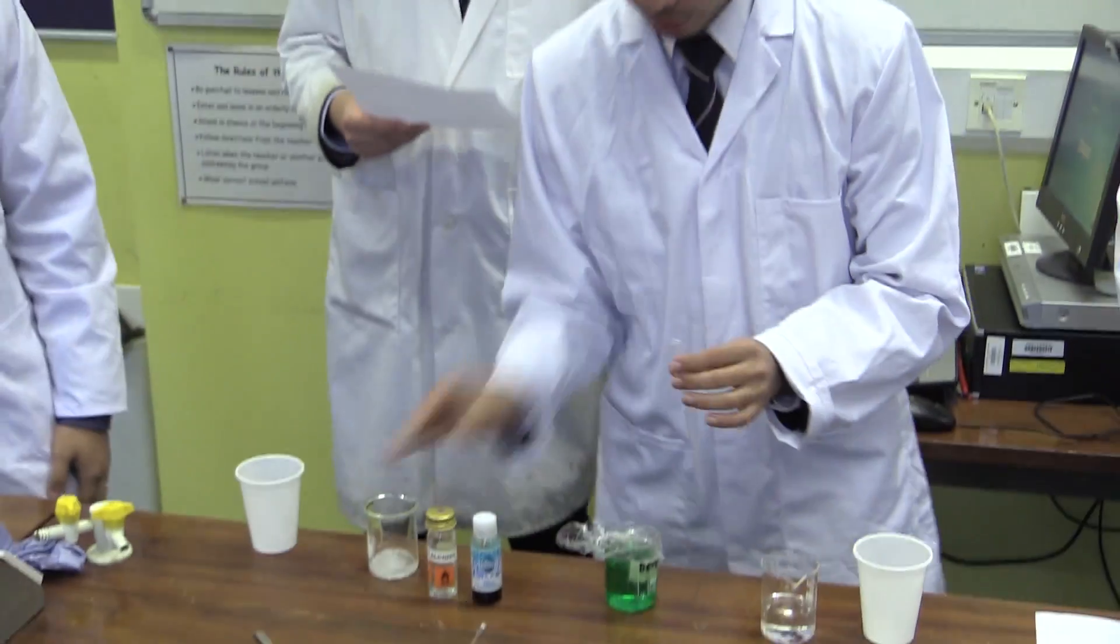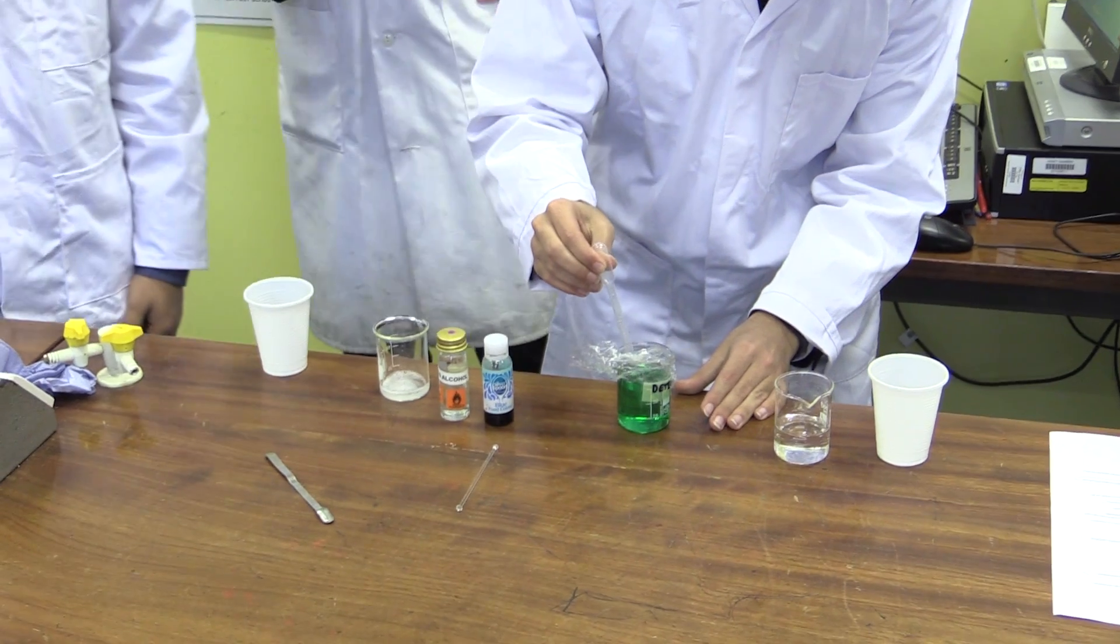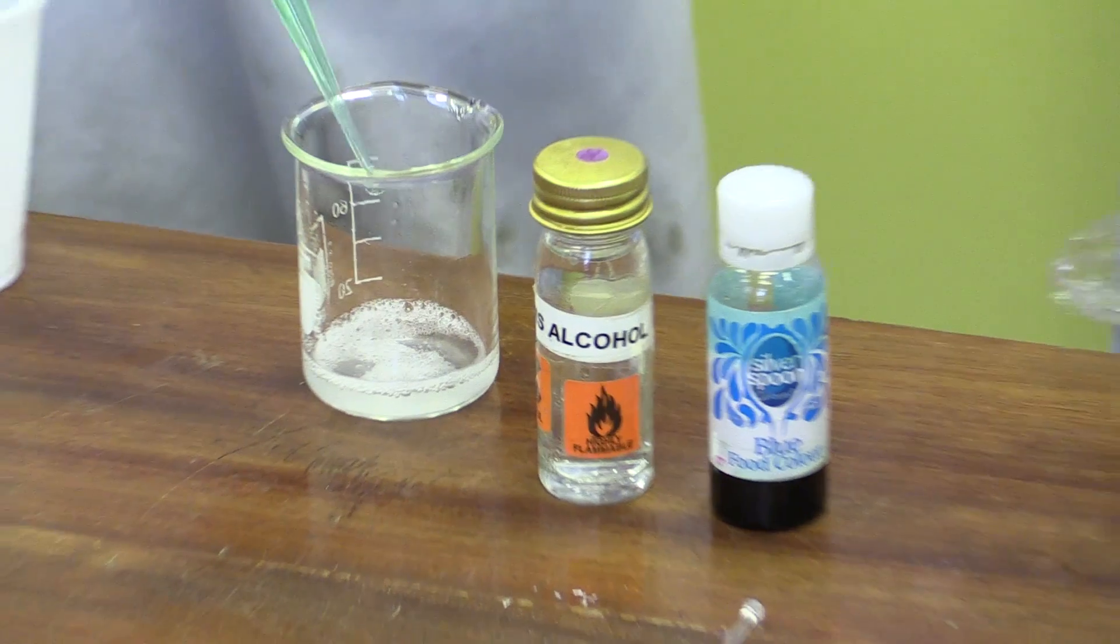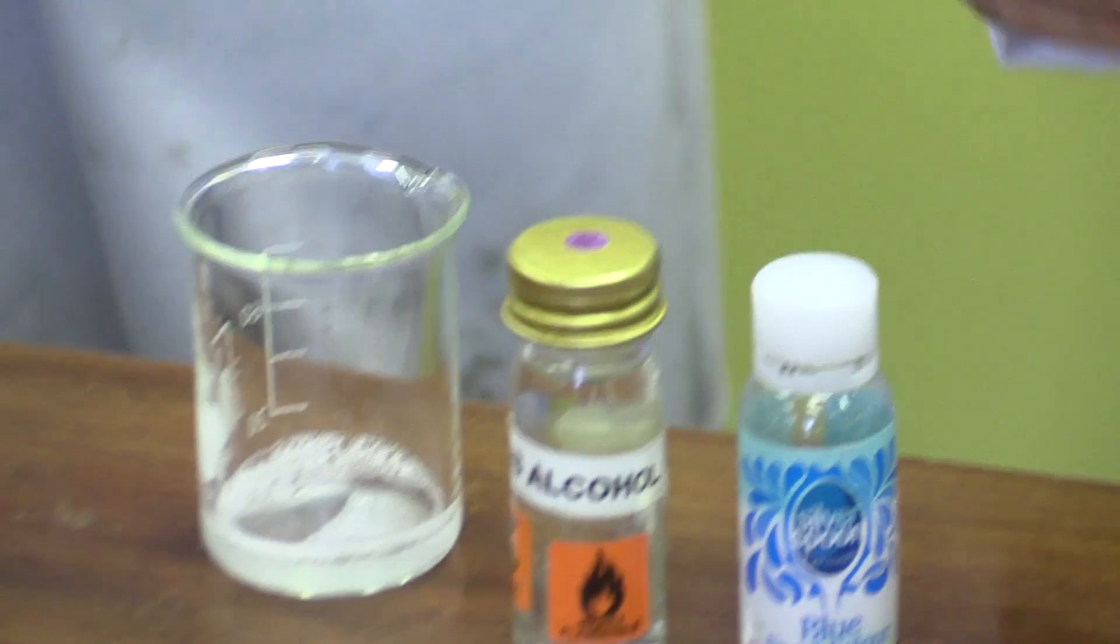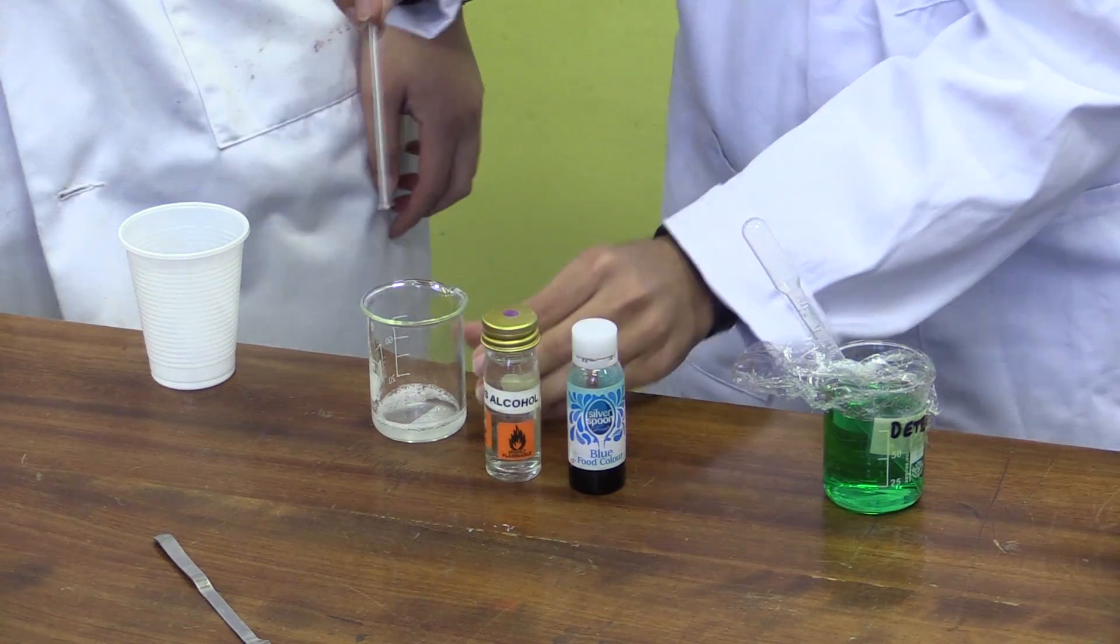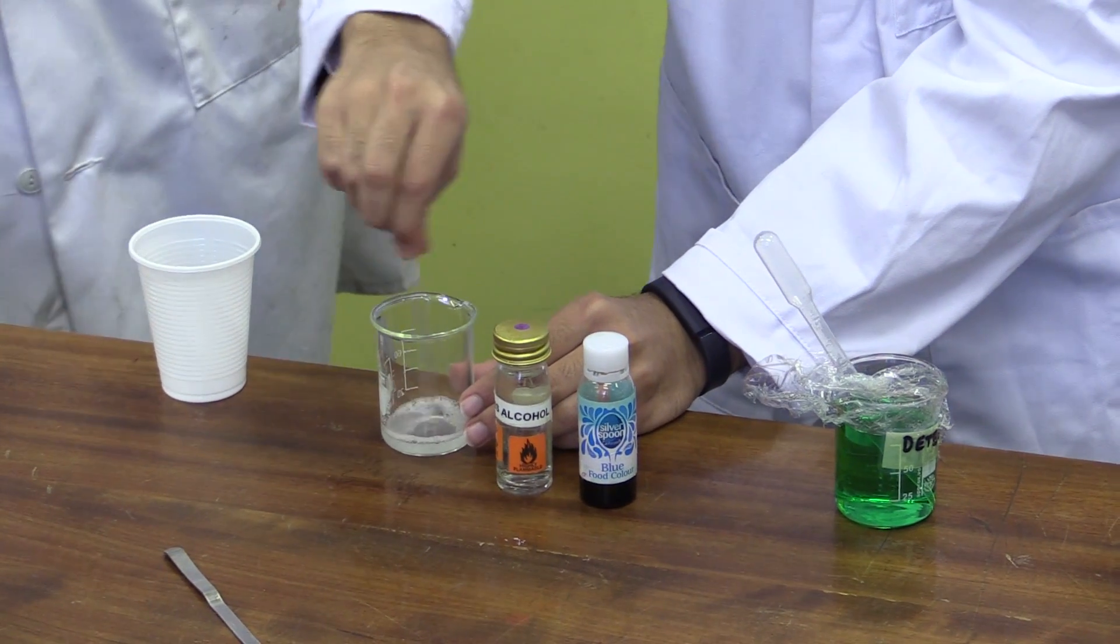Now, we are going to add one drop of clear washing-up liquid to the mixture. Stir it with a stirring rod, trying not to create any air bubbles.